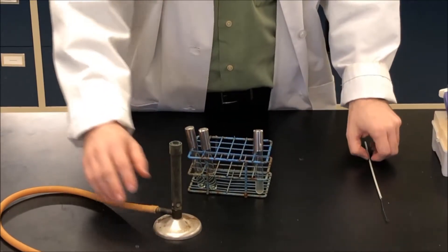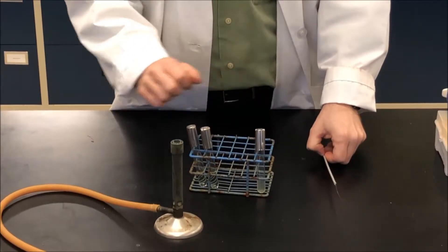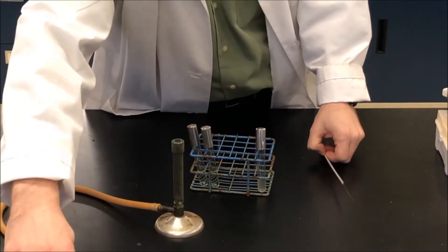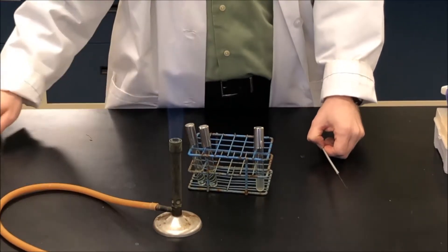So to begin, I'll turn on my Bunsen burner because I want to have aseptic technique. I want to prevent the growth of any unwanted microorganisms.